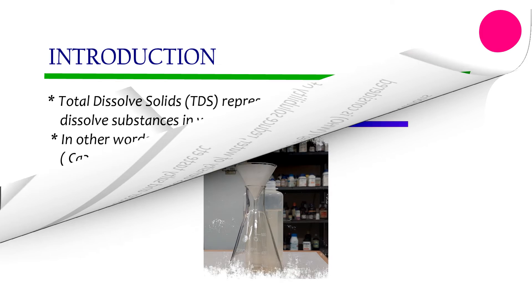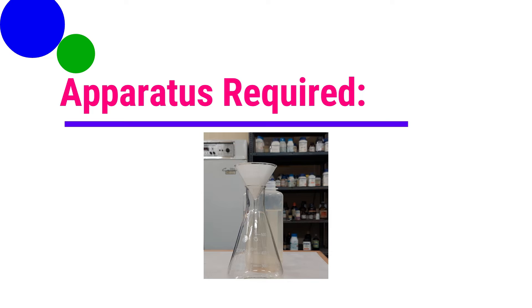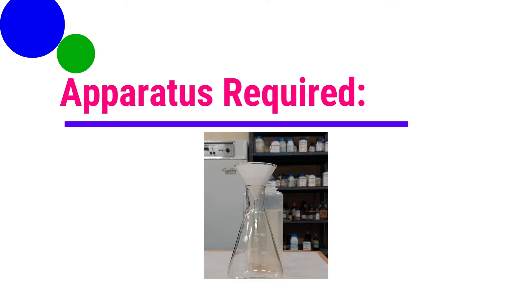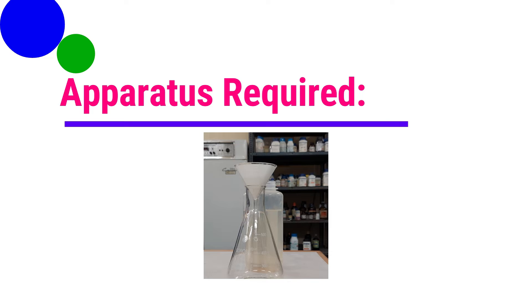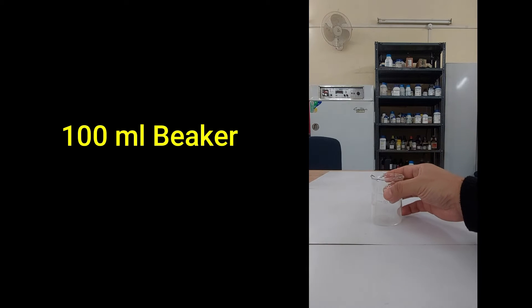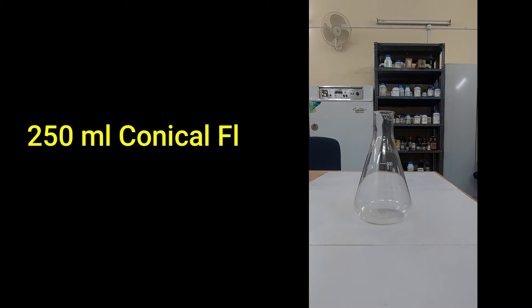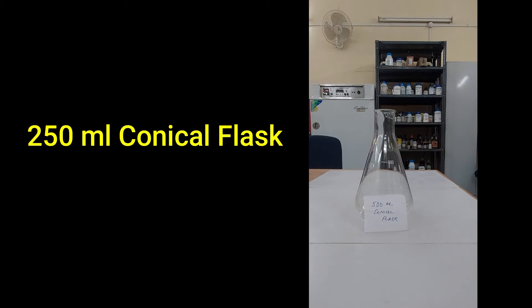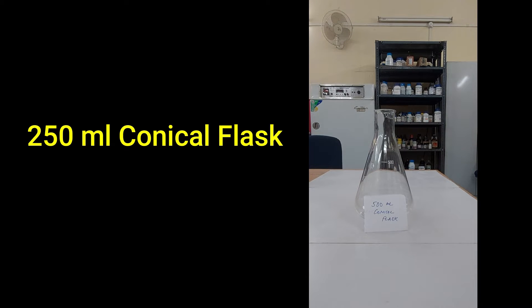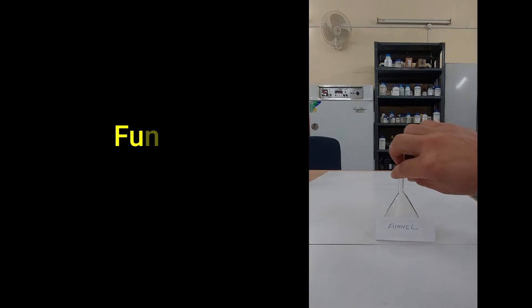Next, let's move on to the apparatus required for estimation of total dissolved solids in the laboratory. The glassware required are: a 100 ml beaker, a 100 ml measuring cylinder, a 250 ml conical flask, Whatman filter paper number 42, and a glass funnel.